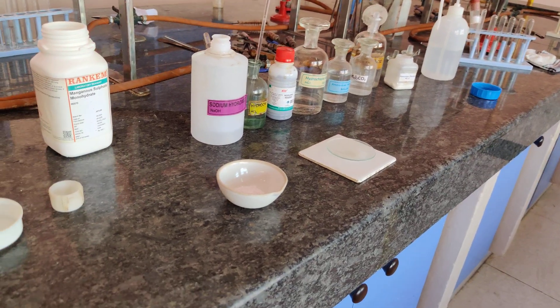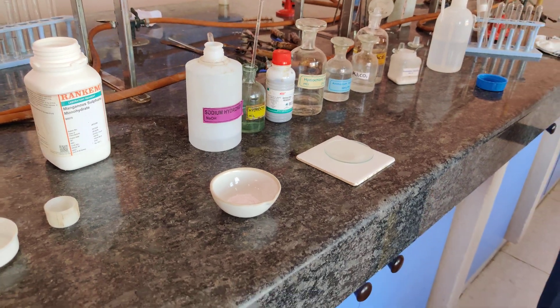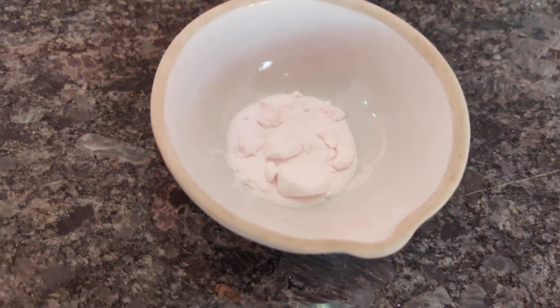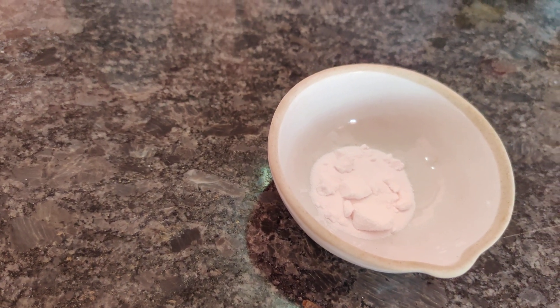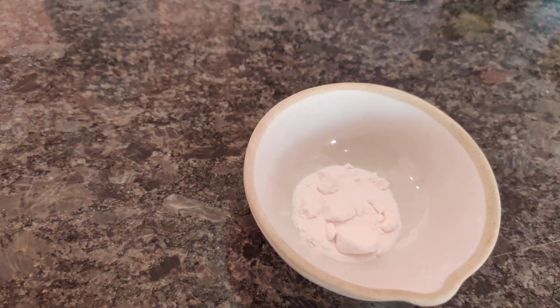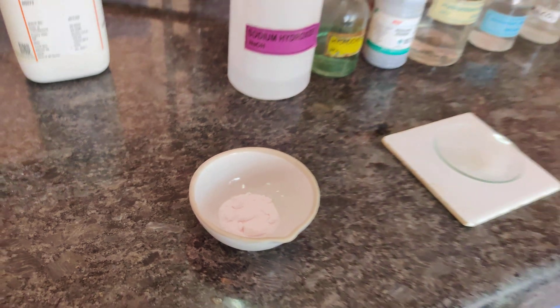Good morning, class 11th and 12th. The agenda for the class will be doing a video of cation analysis of group number 4. The salt that has been given has a tinge of pink — it's a baby pink colored salt. Normally if this happens, there is an indication that the salt could be manganese. But we will be doing it right from the zero group to the fourth group.